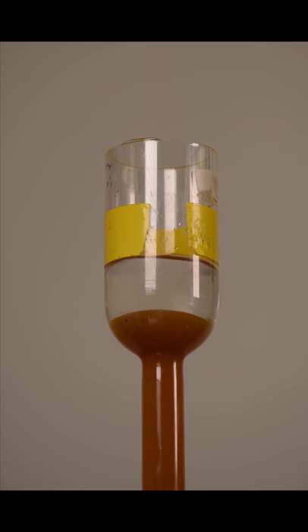Once a flow of water is observed at the top of the resin, the column is completely backwashed.